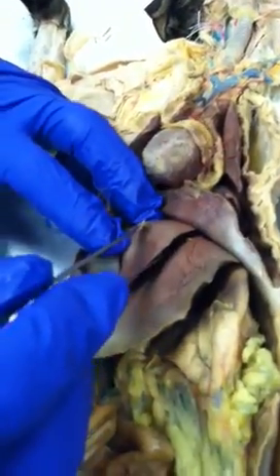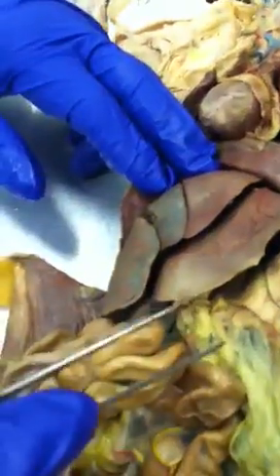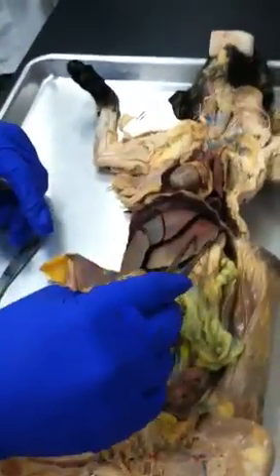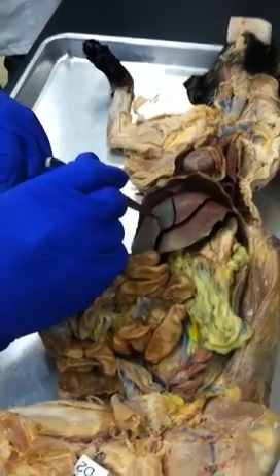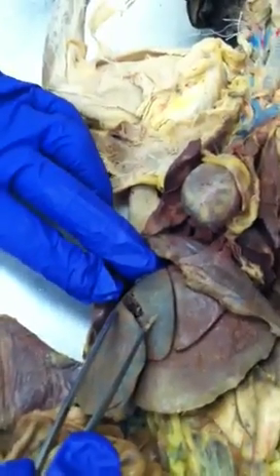All right? And in this case, I want you guys to think about the left-right direction. For the most part, when I'm doing things, I use this, like when you're shaking hands with somebody, you go to the other side. So that's how I can always tell this is the right side and that's the left side. But another thing you can use to tell your right side: you see the gallbladder peeking out on the liver on the right side. So this whole lobe here, from this demarcation right here, would be the right median lobe, right?